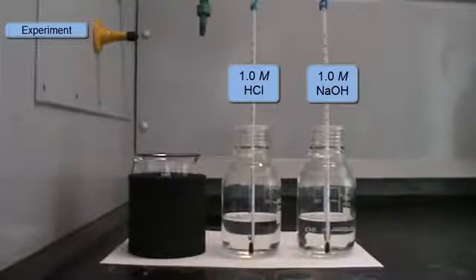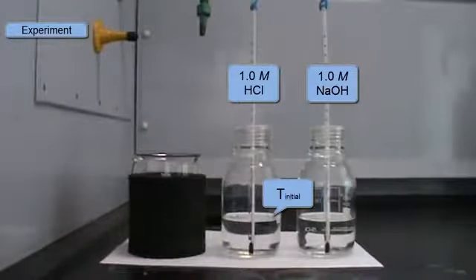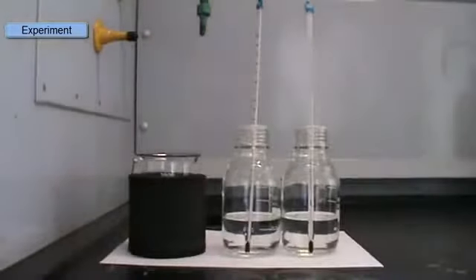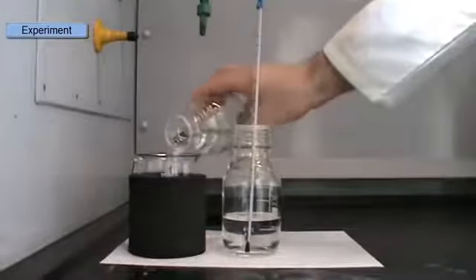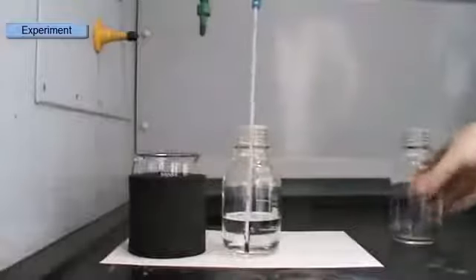Okay, so let's go on now to the experiment itself. So here I have my acid and base that I'm going to mix. They should both be at the same temperature. We need to check that, and that temperature will be the initial temperature, T initial. I'll pour one solution into the calorimeter, so here I'm going to pour the base into the calorimeter. And as before, I'll assemble the calorimeter and put in my thermometer before I start.